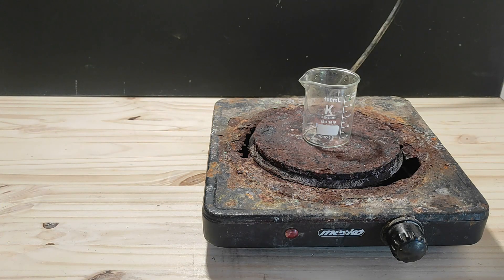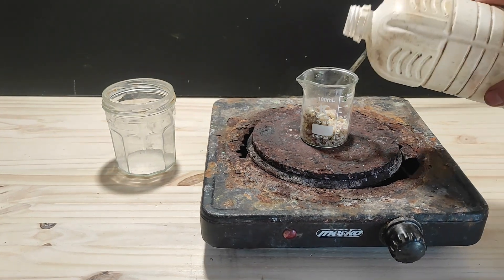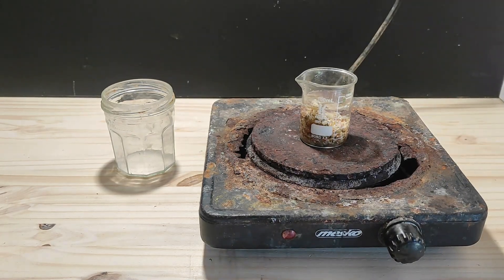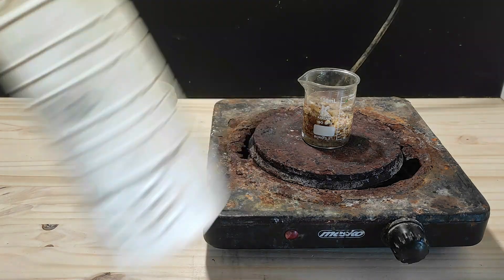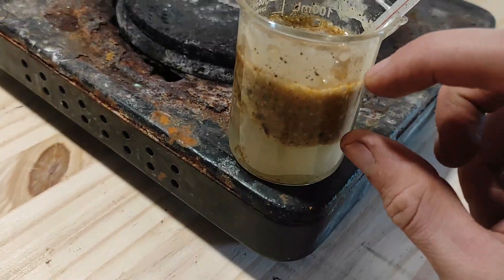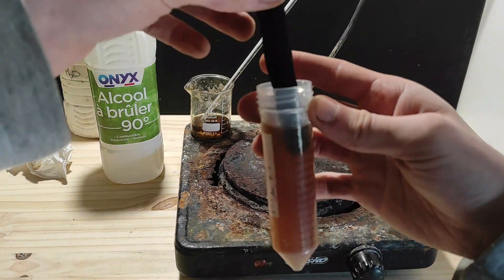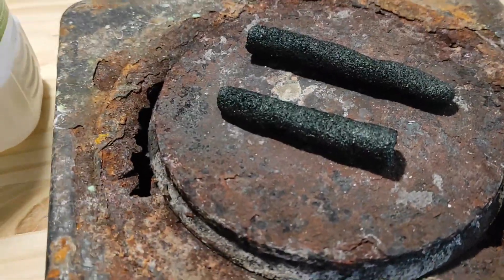First off, I pour everything inside a beaker on the hot plate. What we're going to do is boil off all the residual light solvents — basically everything that boils under 100 degrees will escape. This is also going to melt the resin, and if there are any impurities like wood shards, we can filter them. After some time it looks like a paste, with the light vapors boiled away, and it will solidify upon cooling. Once cooled and solidified, I pour off the water, add ethanol, and turn on the hot plate for mild heat. When we have a good solution, we can dip the washed electrodes fully in and out. The final step is just to dry them on the hot plate.